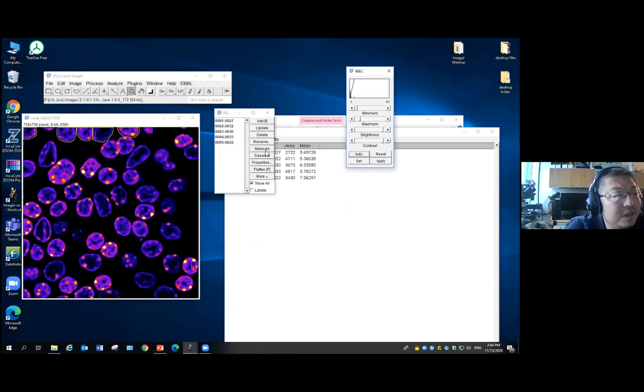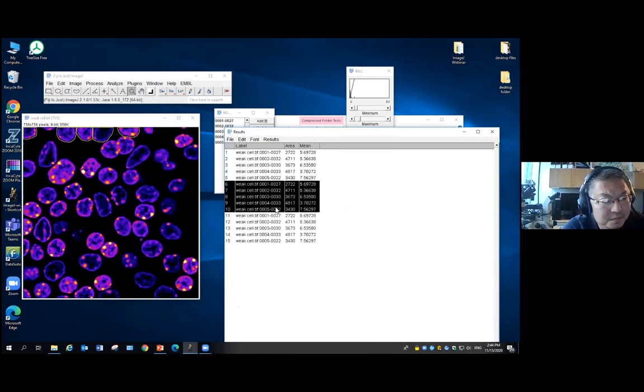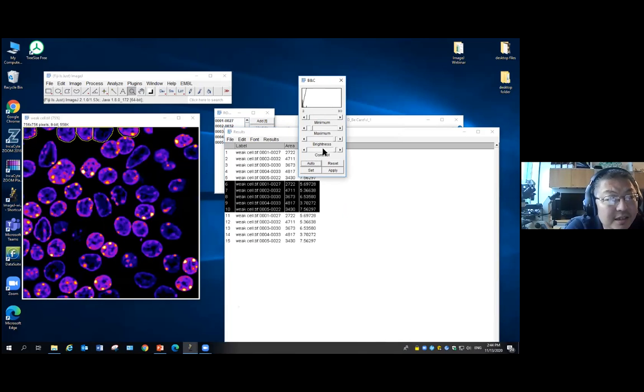And now if I do the measurement again, it's 5. Sorry, I clicked twice. As you can see from here, compared to this, the mean intensity doesn't change. So when you adjust the contrast here, it doesn't really change your pixel intensity on your image. It only changes how it shows up in the microscope screen to help you identify the cells. That's actually what it should do.